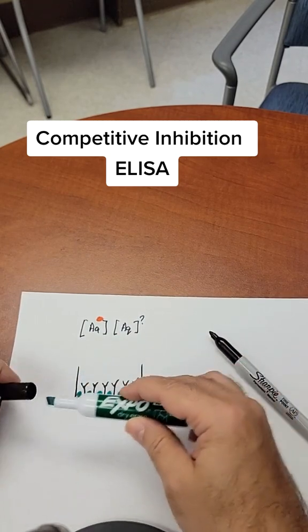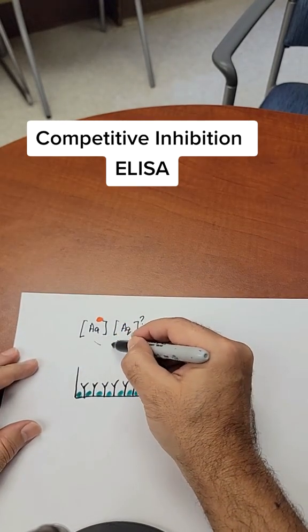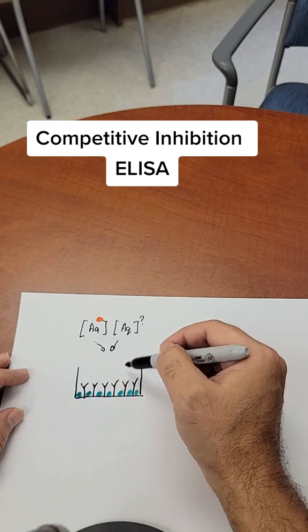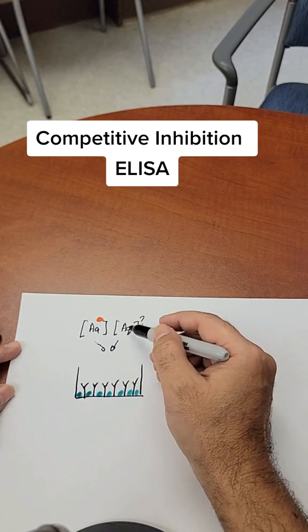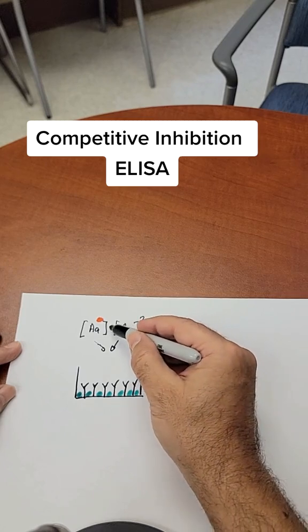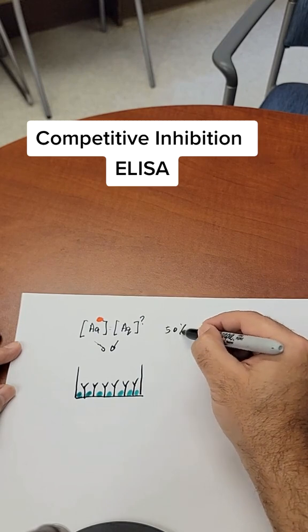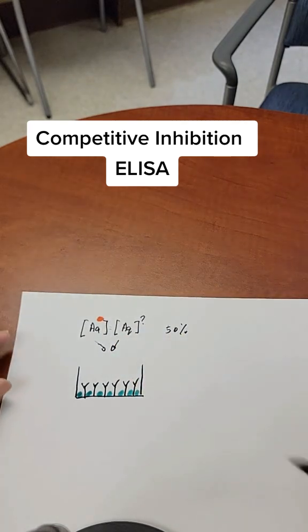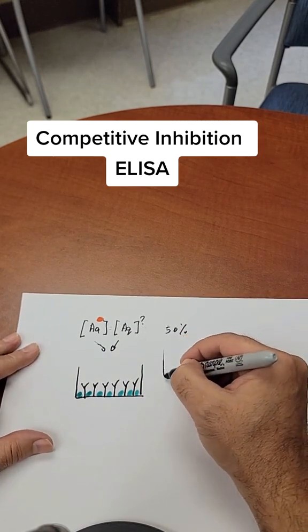It's important to block the sites because all these proteins that we analyze can stick to the plate and give you a background signal. Now we can add both labeled and unlabeled antigens — the labeled antigen and the analyte — to the plate. There will be a competition between the labeled and unlabeled antigens for the antibody. If the concentration of these two is equal, the signal observed will be 50% less compared to the labeled antigen alone. To estimate the actual concentration of the antigen, you can build a standardized curve.